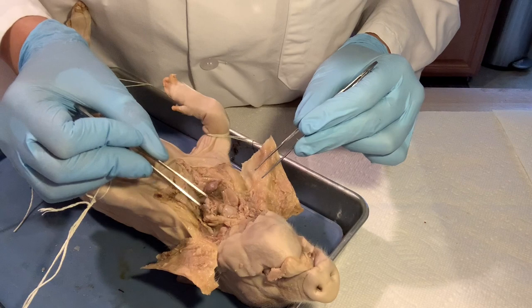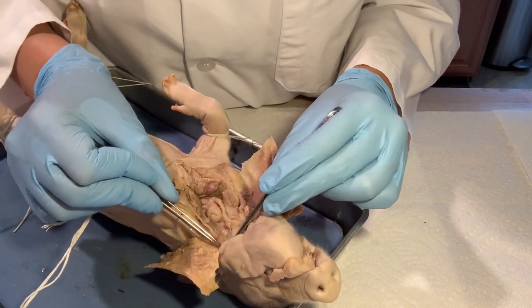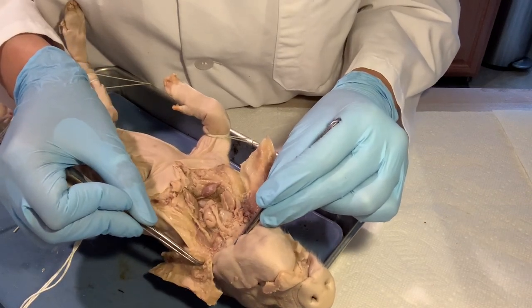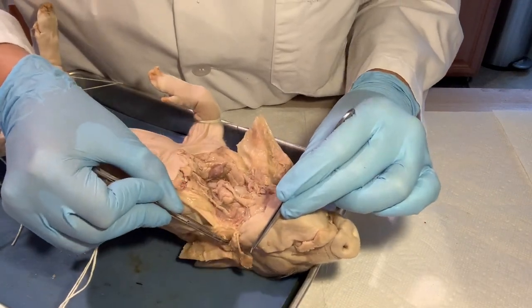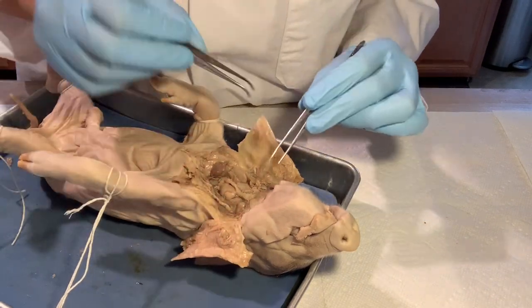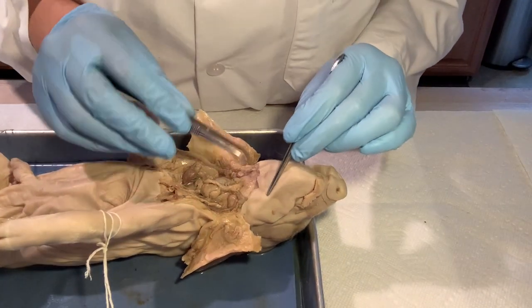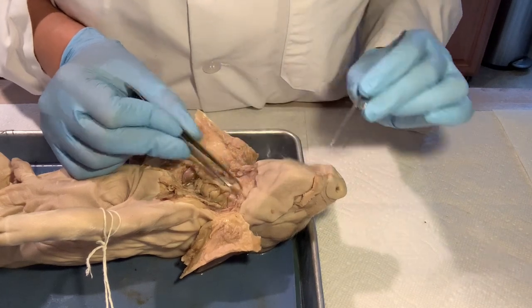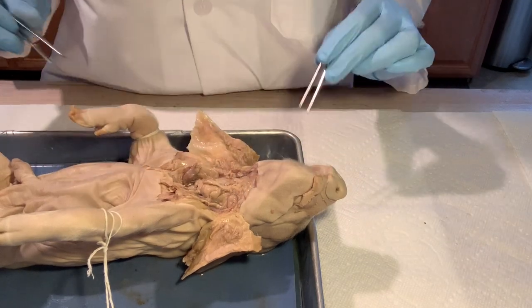There's a salivary gland right here — you can see this little structure. There are three pairs of salivary glands, so you're just looking at one of the three pairs here.